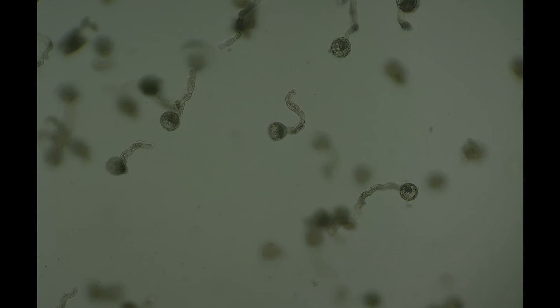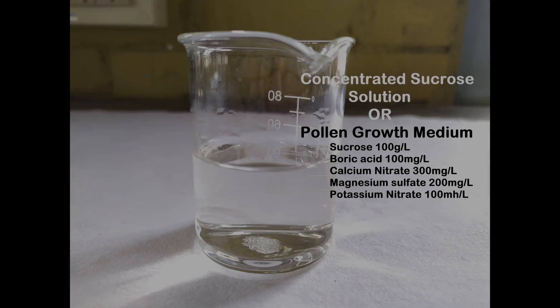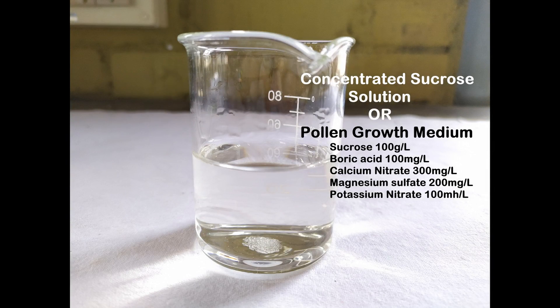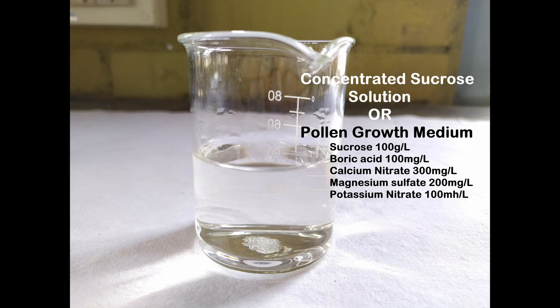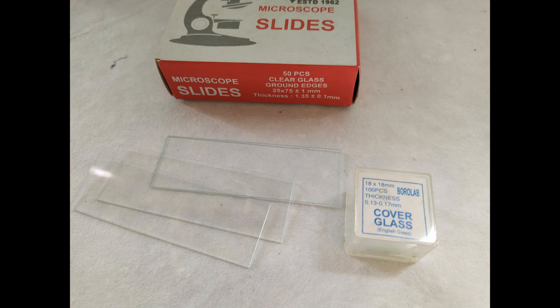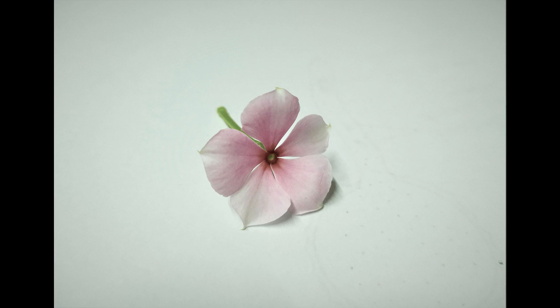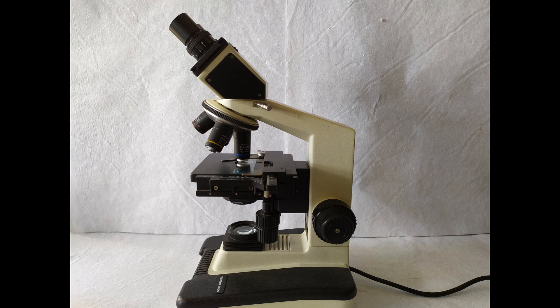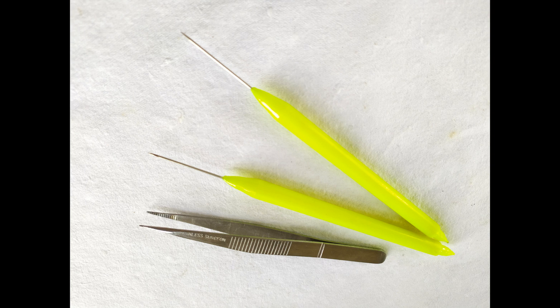For this experiment, we'll need the following: concentrated sucrose solution or a pollen growth medium, glass slides and cover slips, a flower with mature dehisced anthers, a compound light microscope, and tweezers and pins.